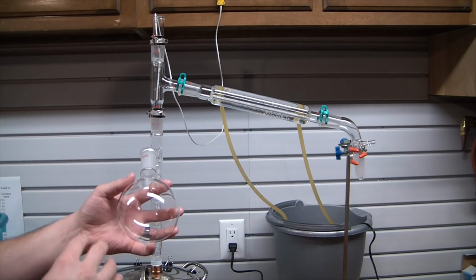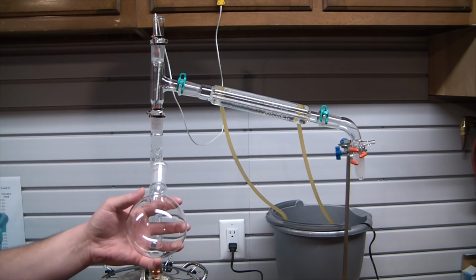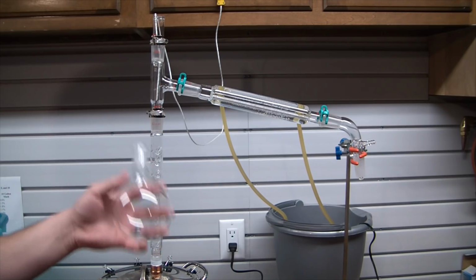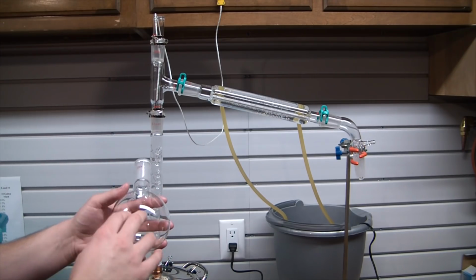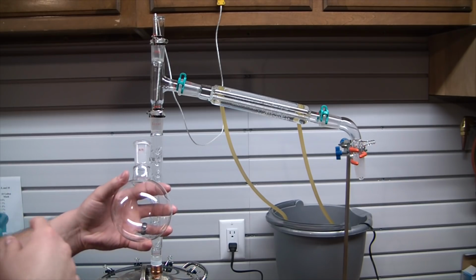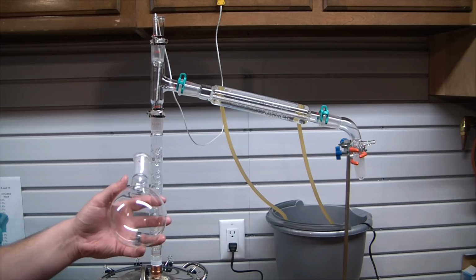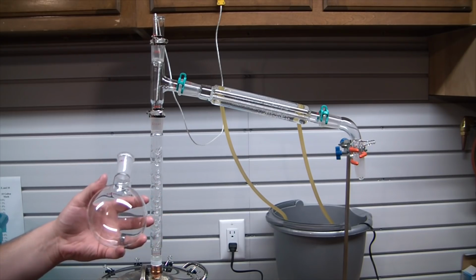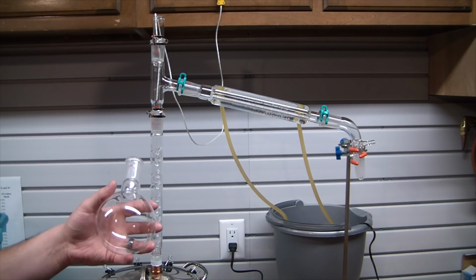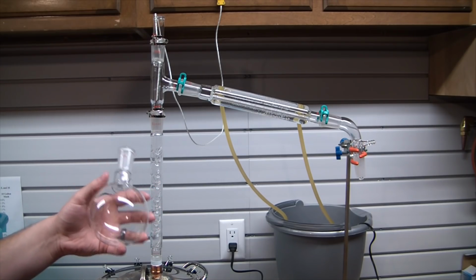But at the same time, if I were doing dangerous distillations, nitric acid, sulfuric acid, mercury, you know, the Nile Red kind of stuff, I would not trust this glassware for that. Back in the detached garage, I have a much higher quality glassware set from Synthware, which is a very good name brand. Ace Glass, Pyrex, Kimble Kontes, all those brands of glass are very high quality, very good.